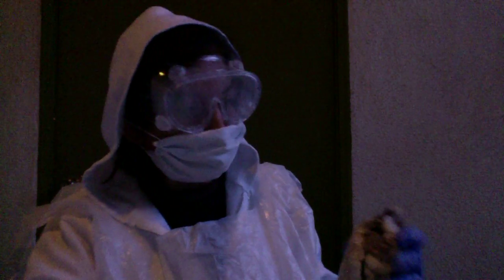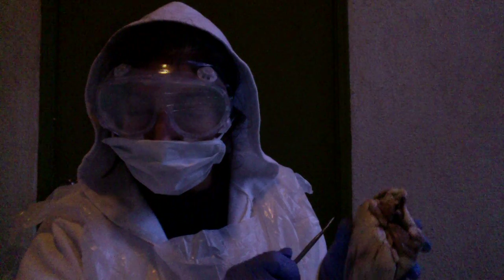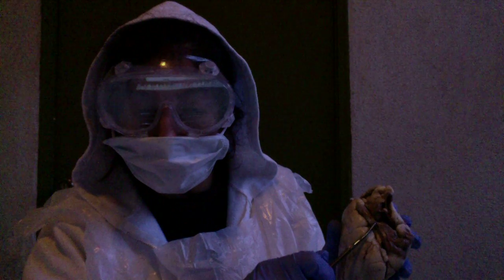And I have the coronary vessels. The pulmonary trunk is in this area up here. Where is the blood going to? A vessel that arises from the right ventricle of the heart, extends upward, and divides into the right and left pulmonary arteries that convey unaerated blood to the lungs.